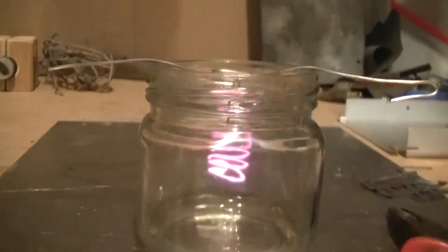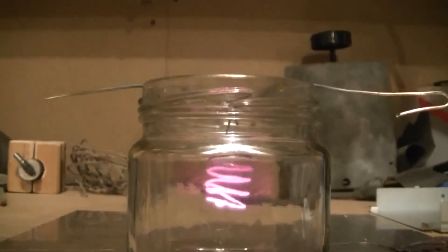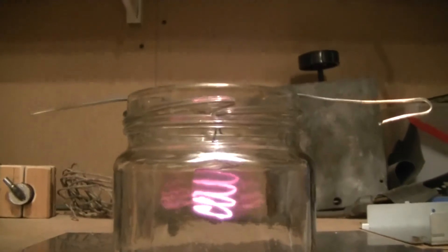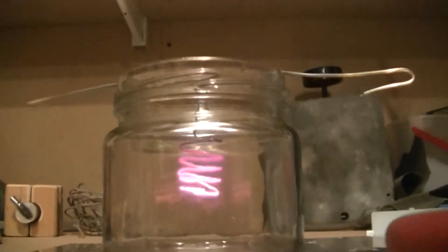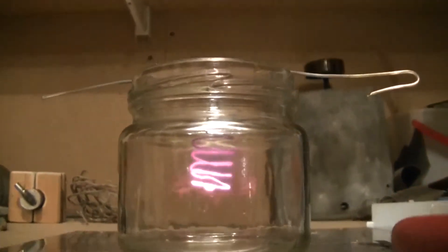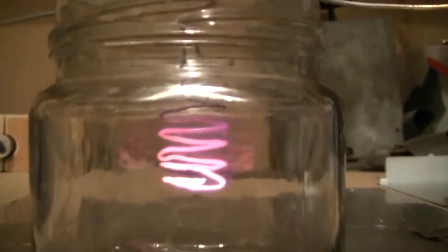So if you get it a little bit too hot, then it passes the flash temperature or whatever, and it'll just do that. So you gotta be careful. Maybe jump a little bit there. But see, it's glowing real nice in there.